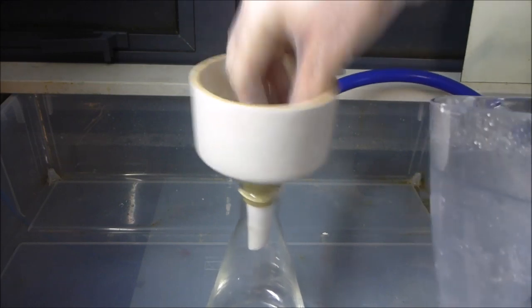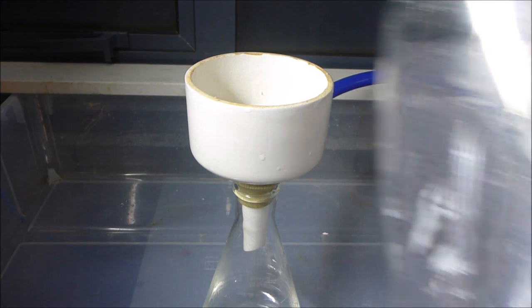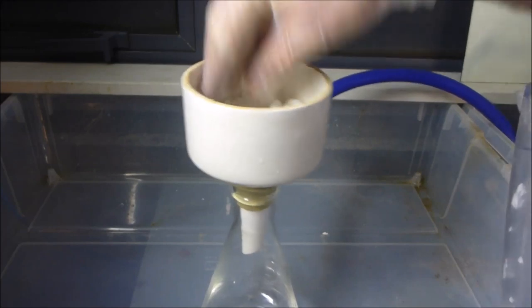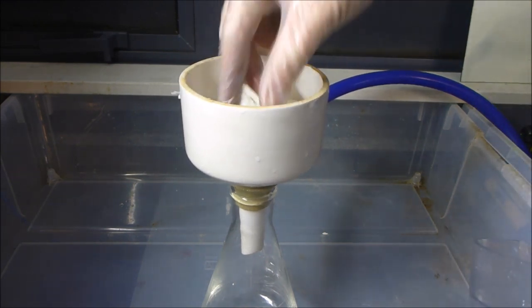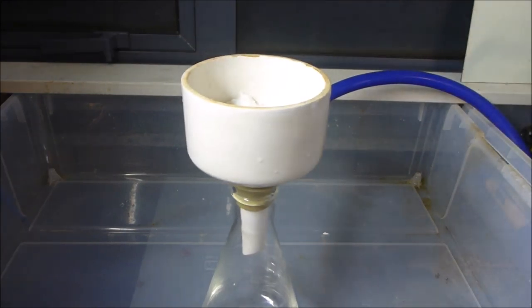This looks okay. A little bit finer chopped up may have been good, but this will be good for a demonstration. Okay. Almost there. It's a nice, relatively quick way of doing this, which is not too bad, and a decent improvement in filterability.